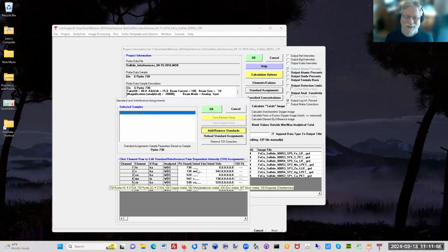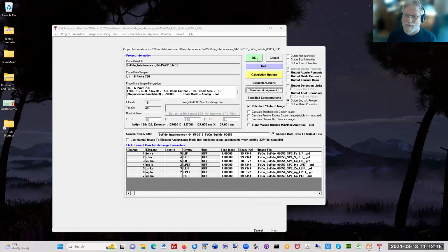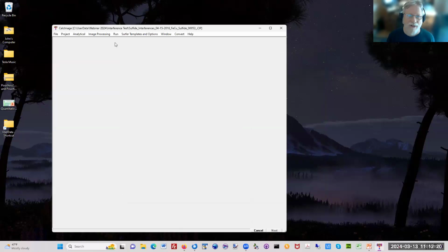But of course, the interference of molybdenum on sulfur is essentially zero because it's such a trace amount. But I put it in there just to be rigorous, because Probe for EPMA can handle self-interferences where two elements interfere with each other, like titanium and barium, or arsenic and lead. So it's kind of cool. And the reason we can do that is because, of course, we do an iterative correction on the thing.